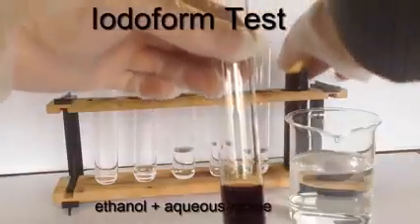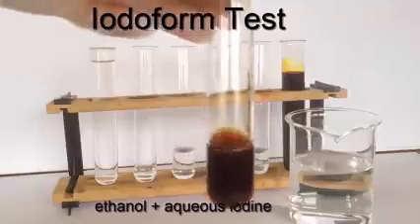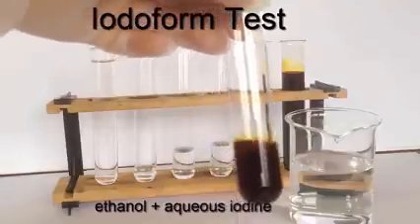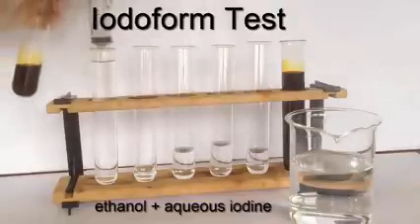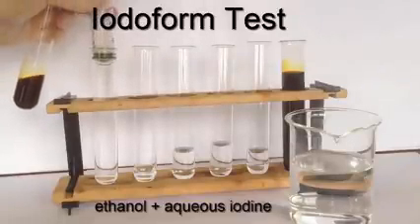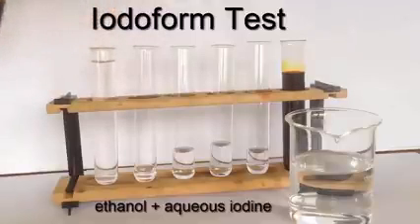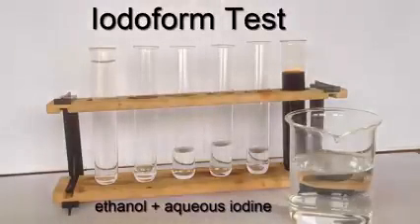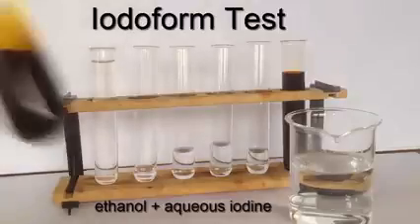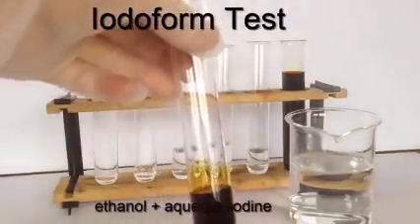Okay, the test will not get underway, as you saw from the equations a moment ago, until I add the sodium hydroxide. So let's do that. I'm going to add 2 molar sodium hydroxide, and recall how that reacts with the iodine to produce sodium iodate(I), NaIO, which behaves as an oxidizing agent. And that will oxidize the alcohol to the corresponding carbonyl compound.